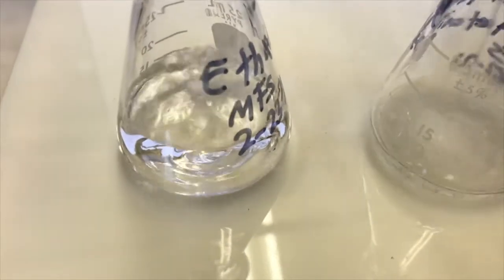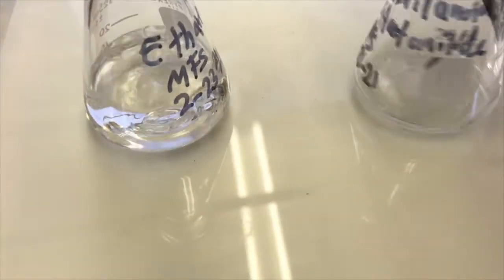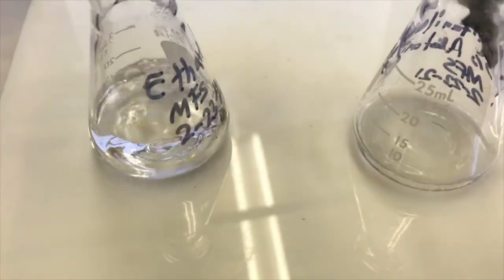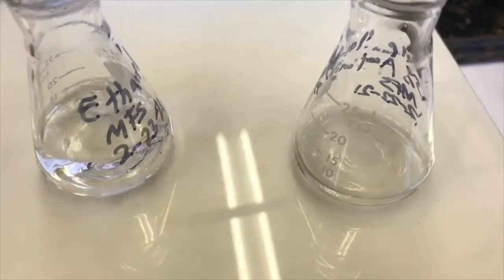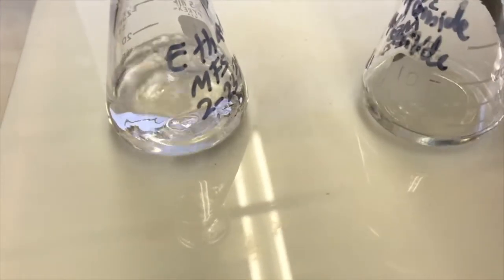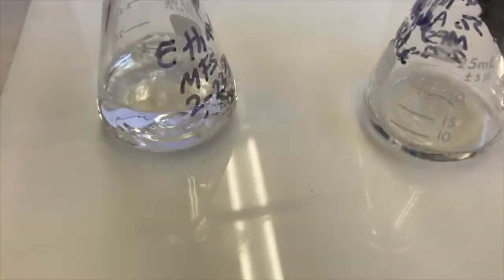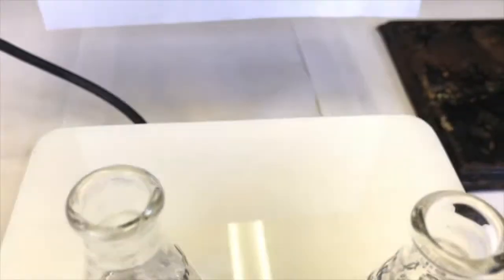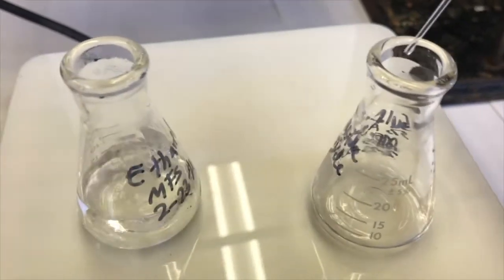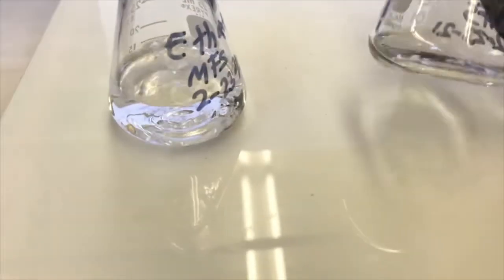And with crystallizations, there's two things you've got to be concerned with. One, that you don't add too much of the hot crystallization solvent. That'll lower your yield and you may not even get crystallization to occur. But also, you don't want to add the crystallization solvent too slowly, because if you're adding it one drop at a time, then you might be adding drops at the same rate that it's evaporating out, and you're not really making a net difference in volume.